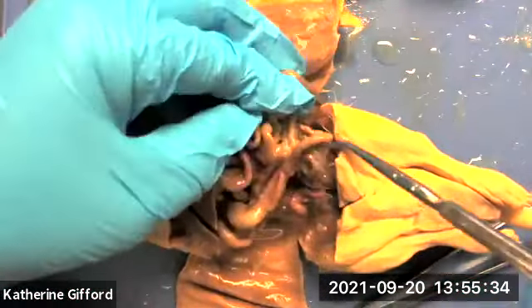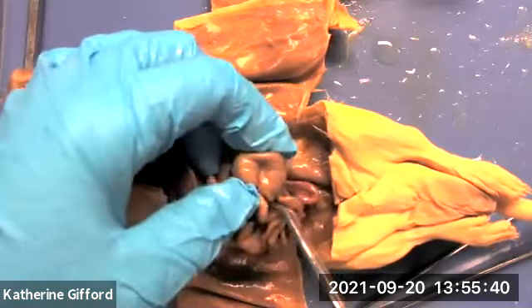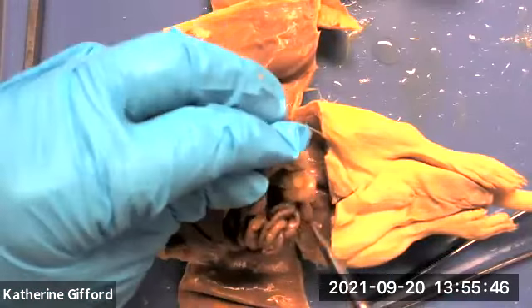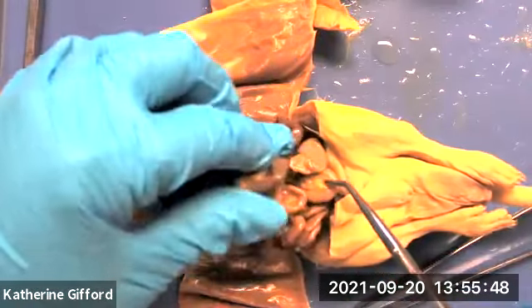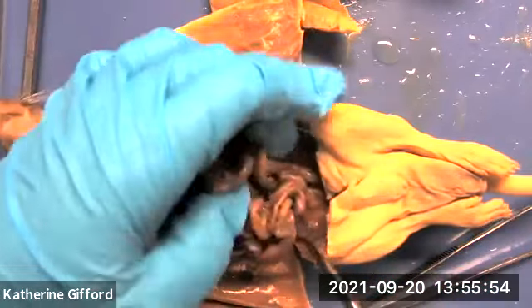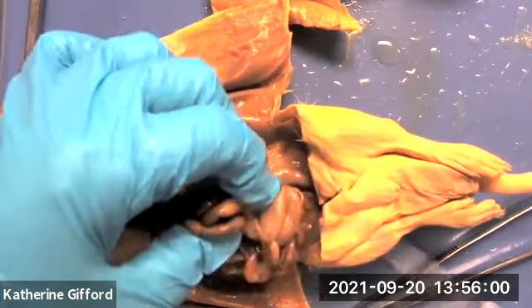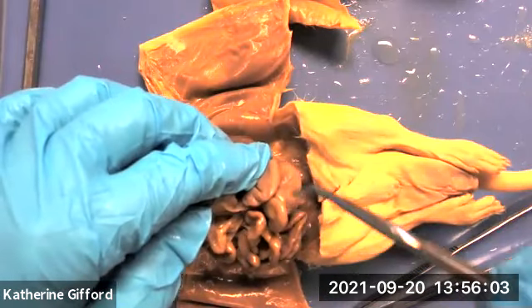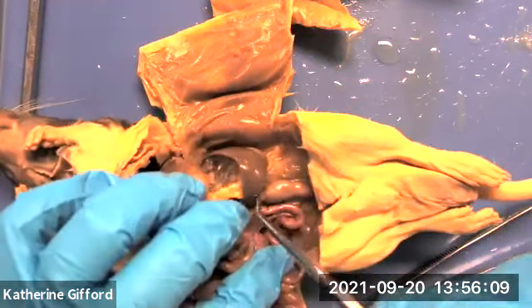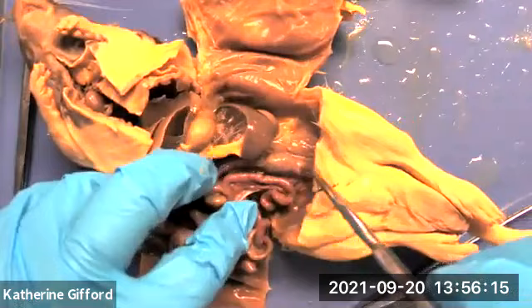If we move things over, we can typically find the cecum, which is this big pocket here. It folds over, receiving chyme and feces from the ileum, and then it empties into the ascending colon. You're not really going to see an ascending or transverse colon, but you see the cecum and you can see the descending colon coming down the middle.